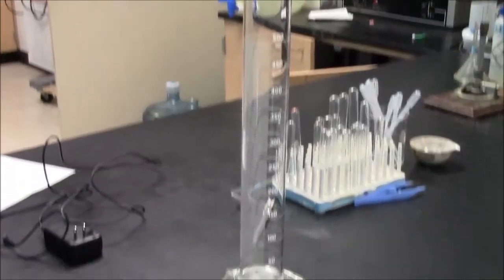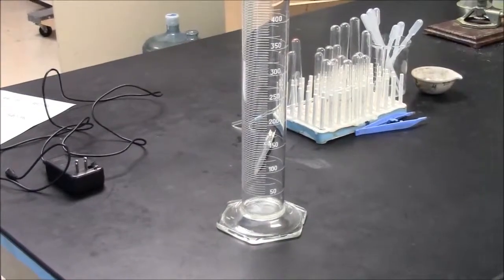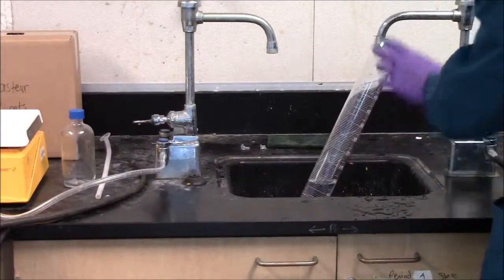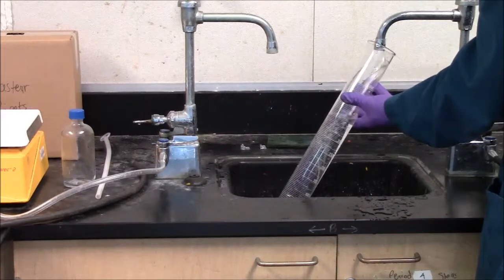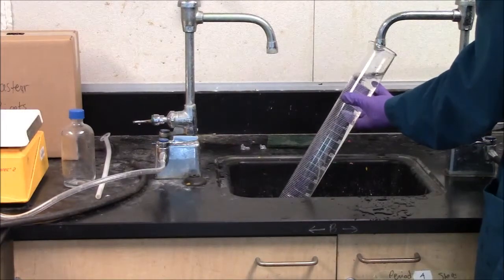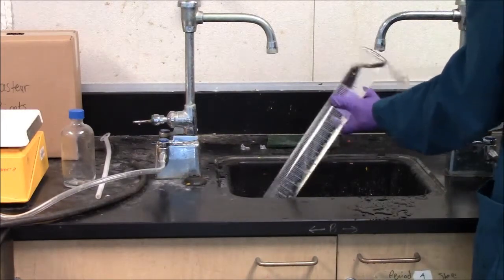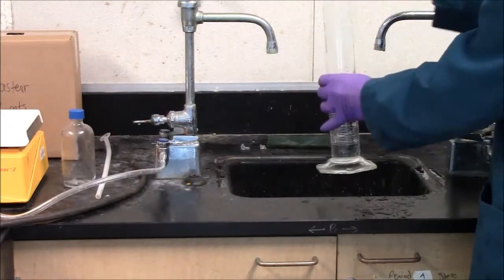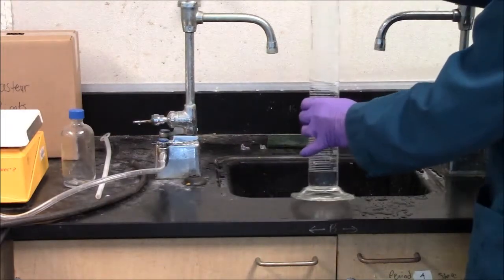Your graduated cylinder then must be filled with water. To fill this last little space you can use a beaker if you like.